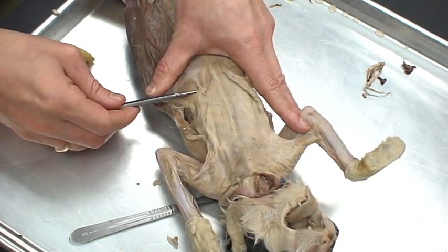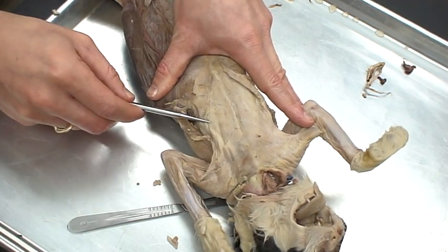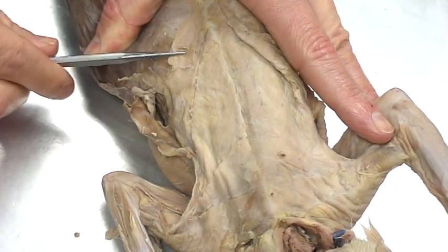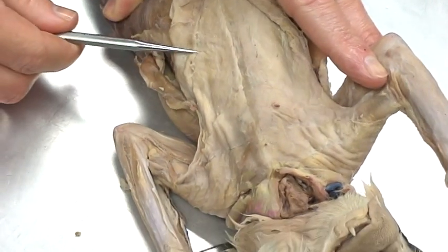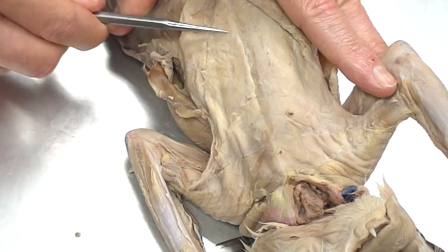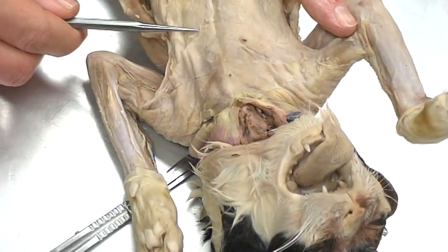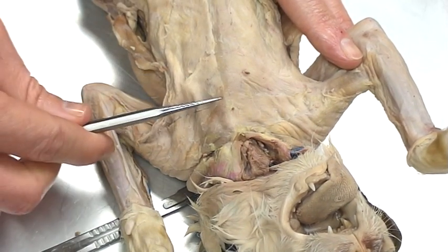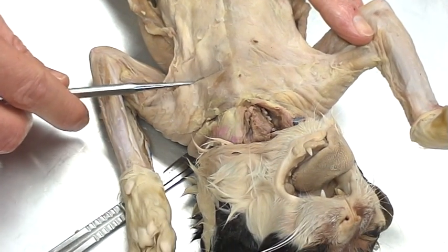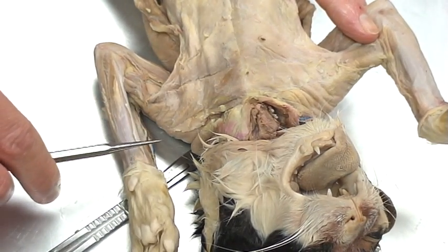First, down here at the pectoral we're going to see the xiphihumeralis. Next up, a little bit more, we've got xiphihumeralis right here. Then the muscle from down here all the way up to here is defined as the pectoralis minor. Next we're going to have the pectoralis major, which is a more triangular shape, defined from here to here. Going up even further we're going to find the pectoantibrachialis.